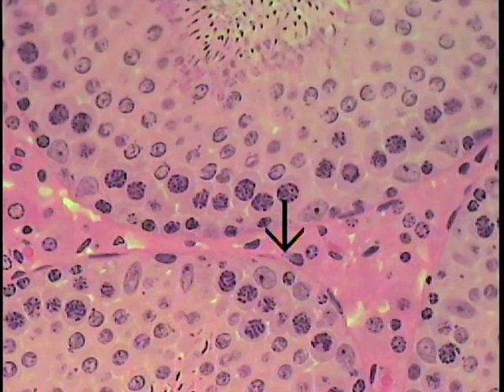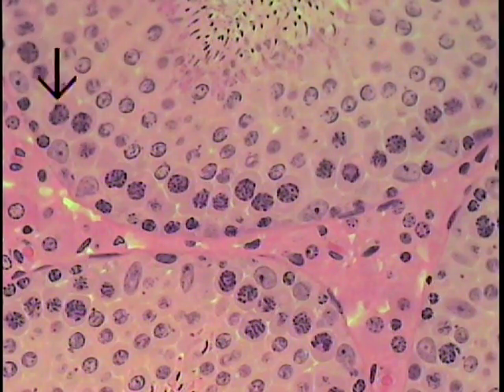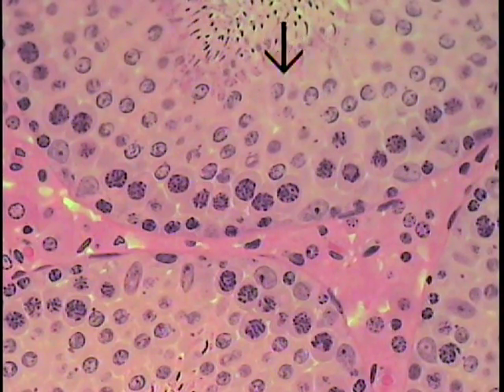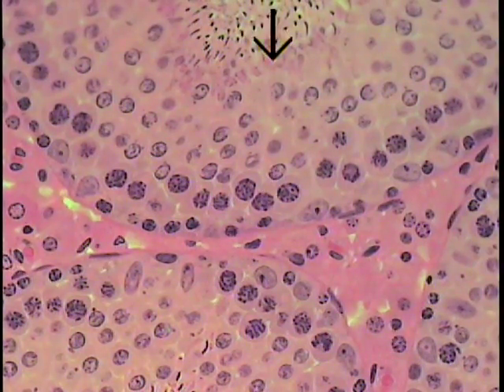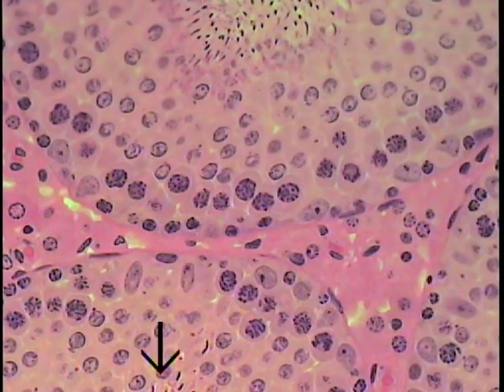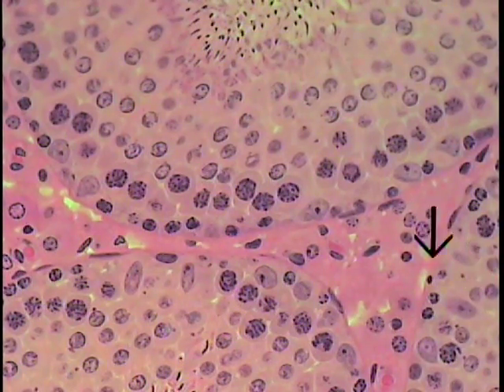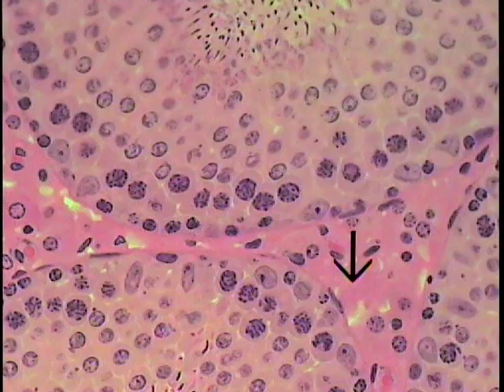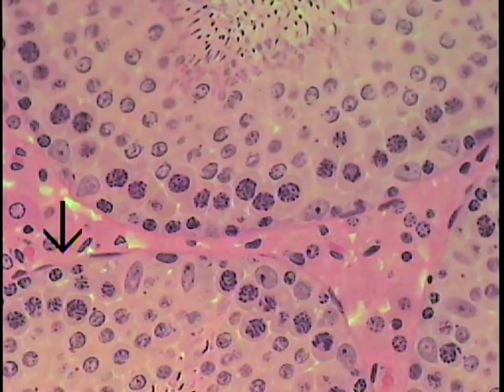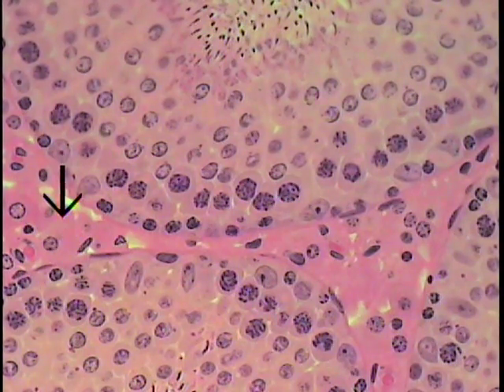This is a portion of the testes seen at high magnification, illustrating a seminiferous tubule here with this stratified epithelium being the germinal epithelium, a portion of a seminiferous tubule located here with its germinal epithelium, and a portion of one here. Interposed between the seminiferous tubules, and indicated by the arrow, is the interstitial tissue, which contains several interstitial cells.